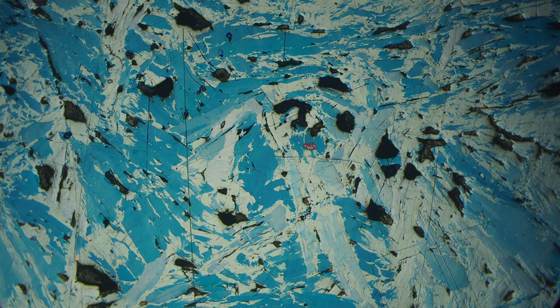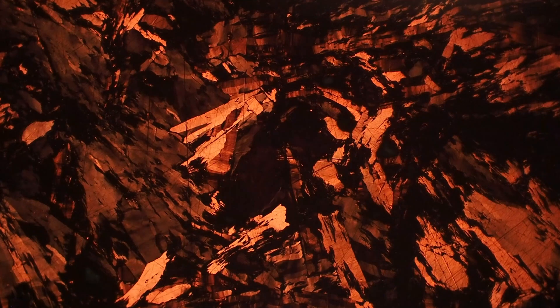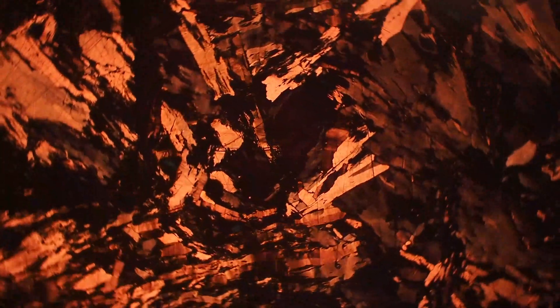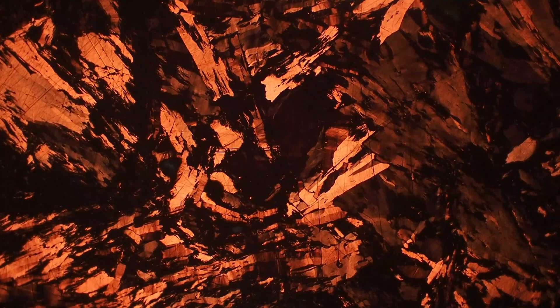Next we're going to put it in cross polars, and now we can see the strong anisotropy that covellite has. As we rotate the stage you can see it going from that red-orange color to brown or gray. Watch a single crystal and you can see how it goes back dark and then back to a bright red-orange color.